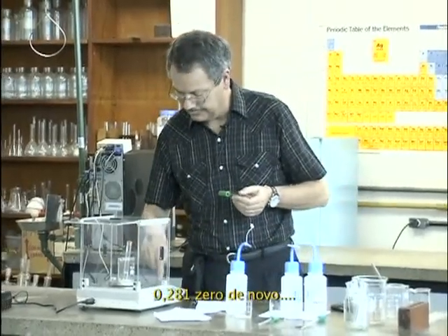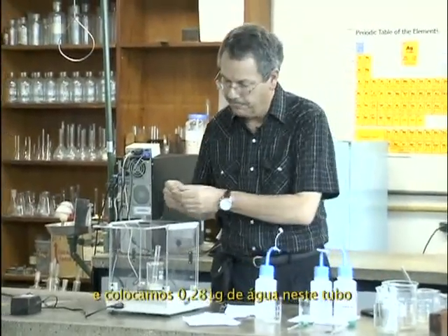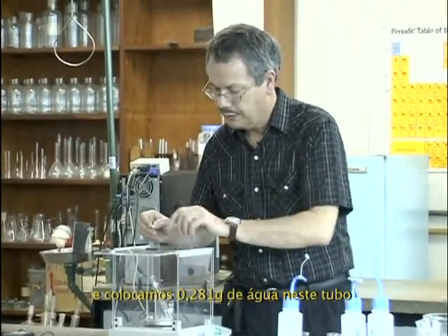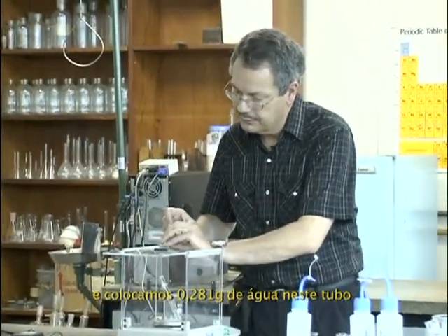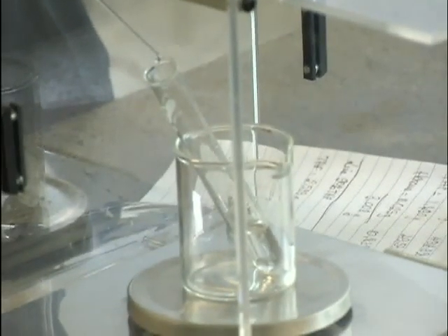0.281, zero again, and I will drop 0.281 water in this tube. It's 0, yes.